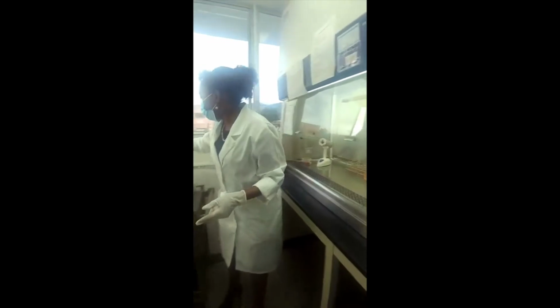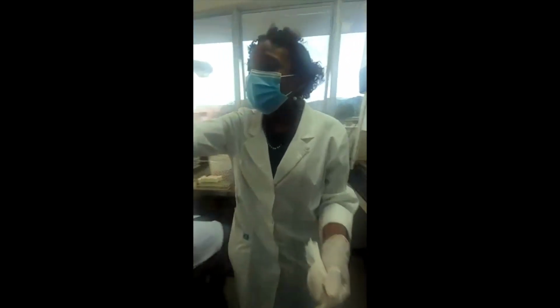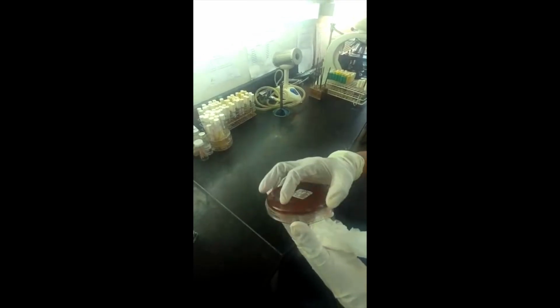We'll do our gram stain. And on this side, you will see they would have had the plates and they use biochemistry and all other things to do ID and susceptibility testing. This is just a picture of something that grew before, and then its susceptibility testing, just to give you an idea of what things look like.